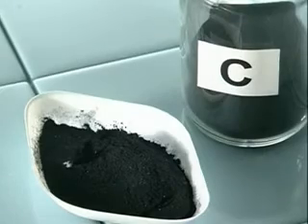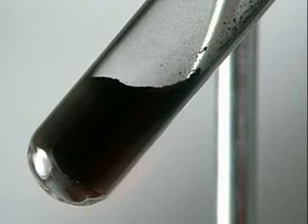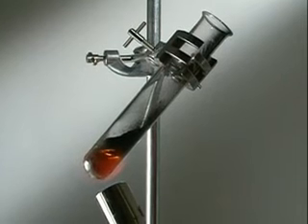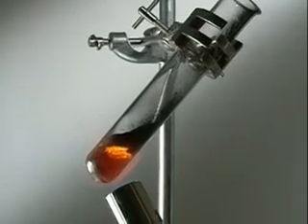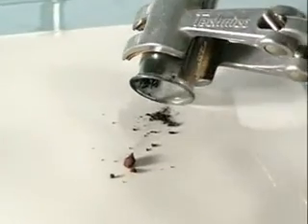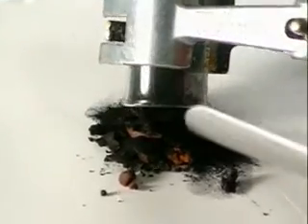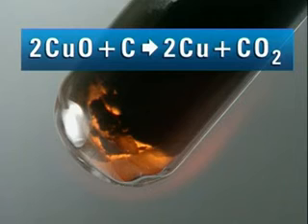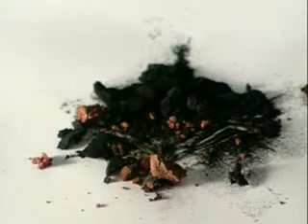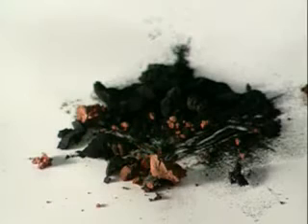Carbon is a much safer reducing agent. Mix it with copper oxide and simply heat in a boiling tube. Carbon reacts with oxygen in the copper oxide and solid copper forms. Carbon is more reactive than copper — it's able to remove the oxygen and form carbon dioxide. While the copper oxide is reduced, the carbon is oxidised.